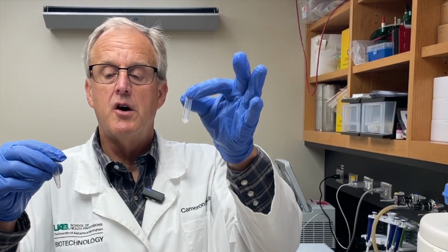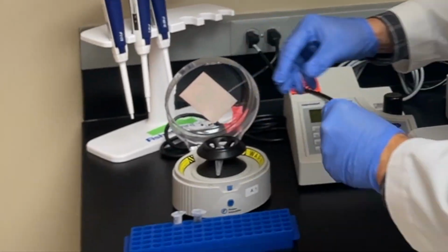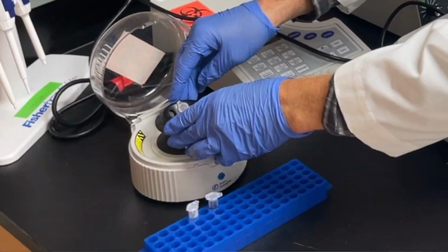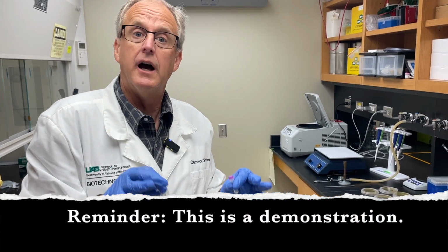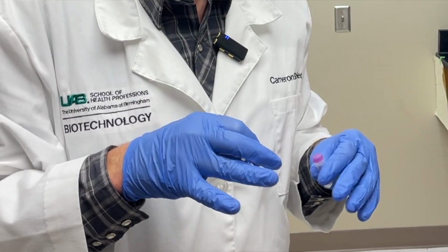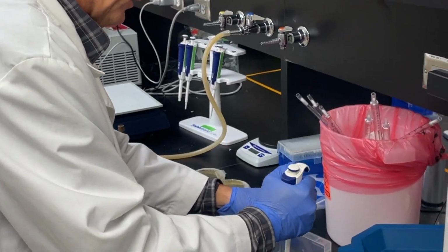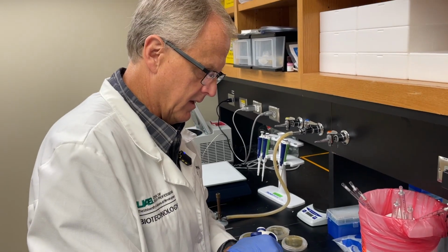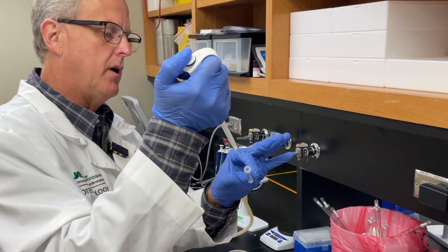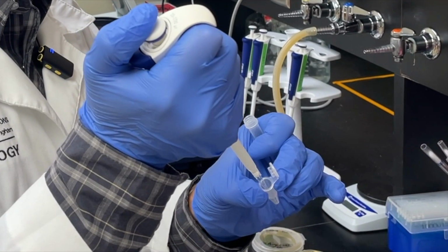Our bacteria is thawed out and our plasmid is thawed out. We are going to quickly centrifuge to bring it down. Now, I deviate from the manufacturer. I teach a 2-hour class, so I've modified a little bit. Here's the deviation. This has approximately 50 microliters in here. What I do, I am going to transfer 25 microliters from this tube into a new Eppendorf tube.